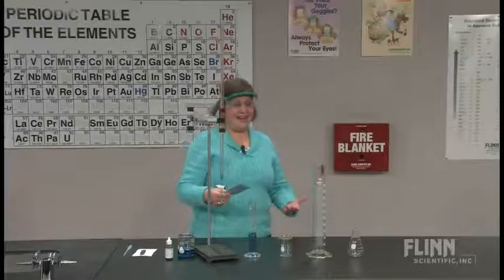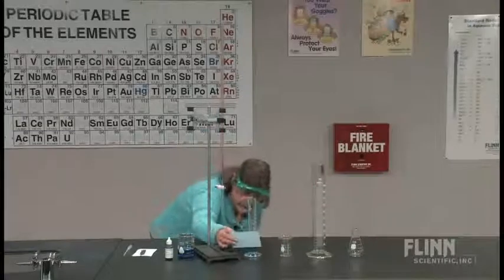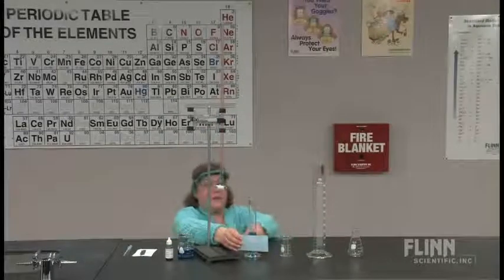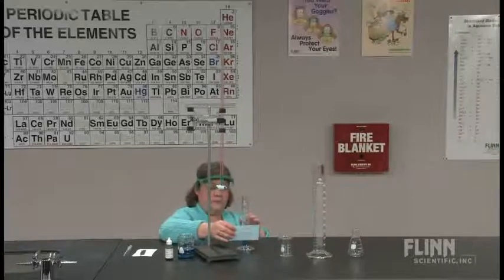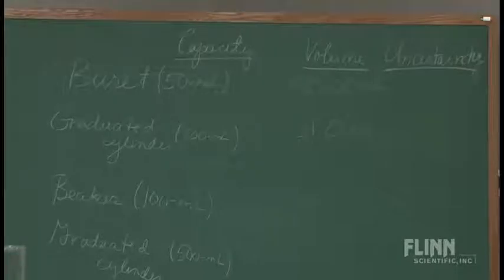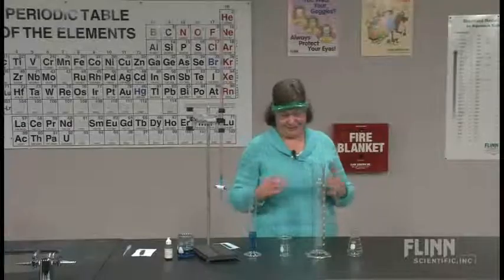So I'm going to get down again so that I can see that estimate. I'm actually going to do that down here. And I'm going to read that as... It's actually 51.0. Now there's the first thing. Well, it was 50. Now you're saying it's 51. What does that mean? Well, that's sort of the point of the demonstration.